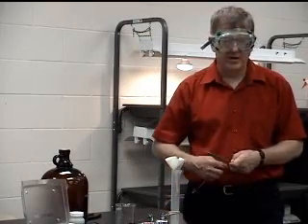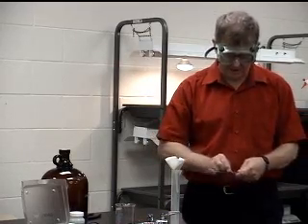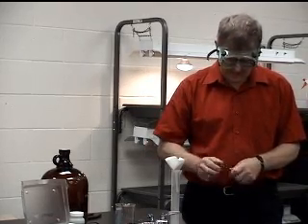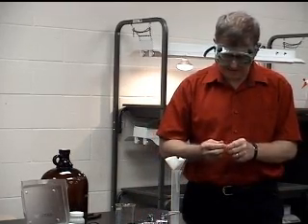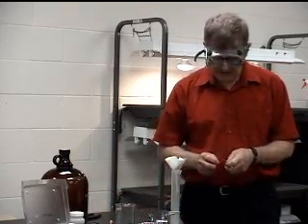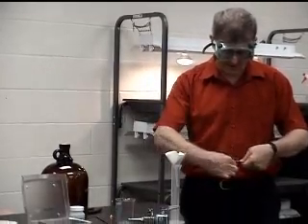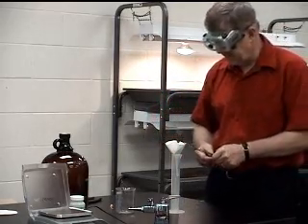Okay, what we're going to do here is take a look at slightly soluble materials. The most soluble of the slightly soluble materials is silver acetate, and silver acetate is actually, for something classified as slightly soluble, quite soluble. You can have the students check the Ksp of silver acetate by reacting a saturated solution of silver acetate with copper wire, if you can afford the silver acetate.